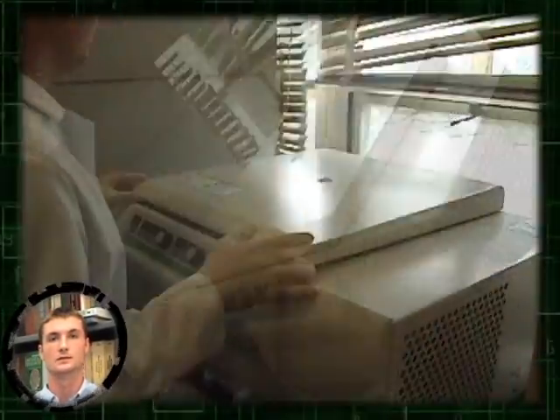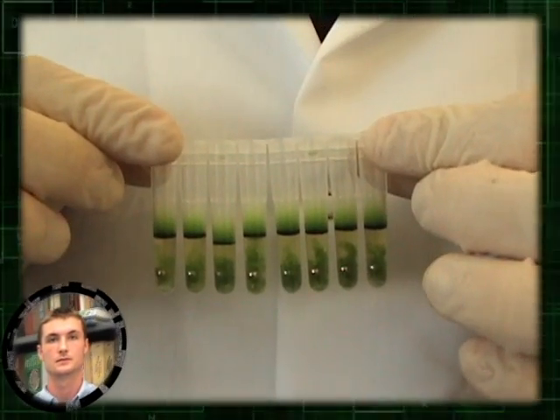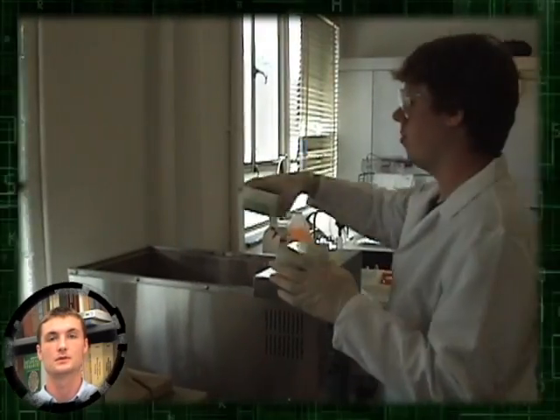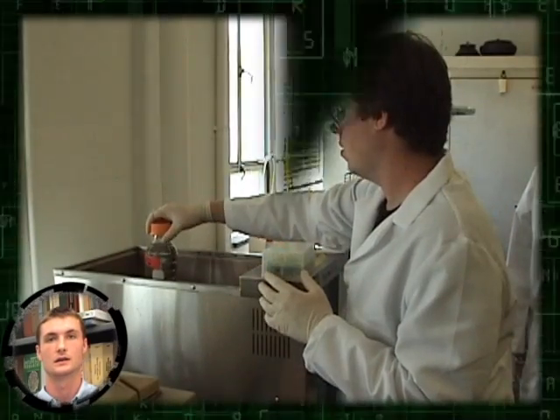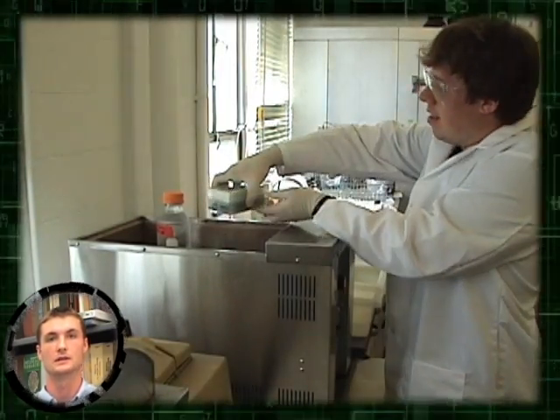The racks are then spun in a centrifuge to reduce foam. Samples are then heated for 10 to 15 minutes at 68 degrees centigrade. This step helps the detergent break up the membranes and release the DNA.